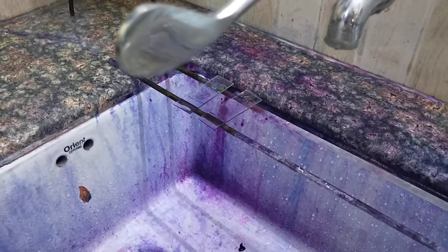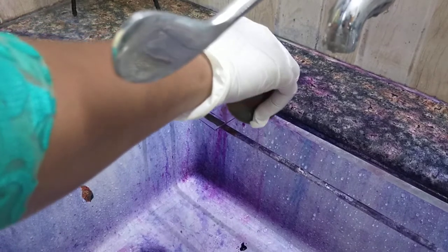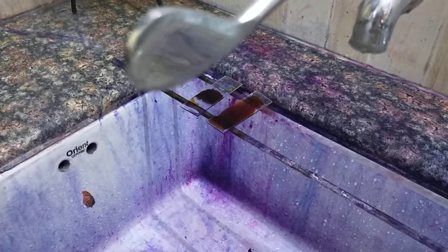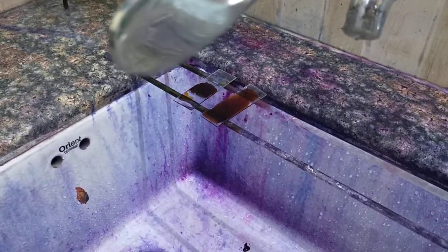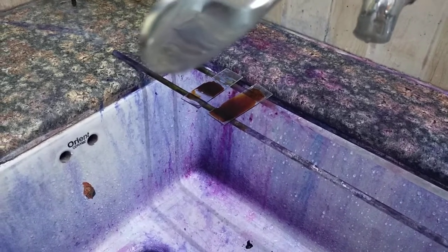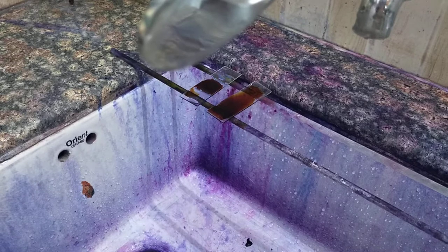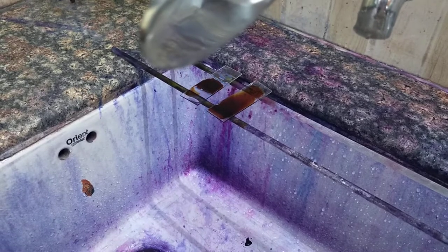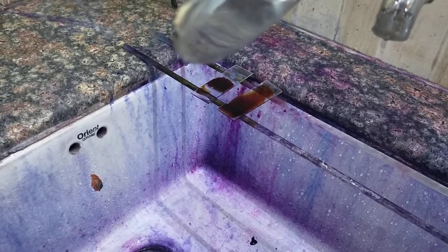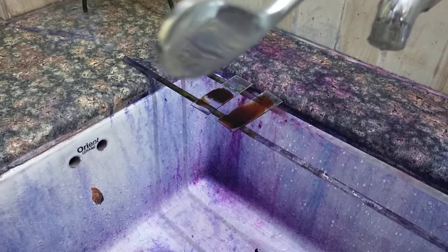So 1 minute is over. After this we will wash and then we will put iodine — Gram's iodine — for 1 minute. Iodine acts as a mordant and it fixes the primary dye to the cell wall. So for 1 minute we will keep iodine.